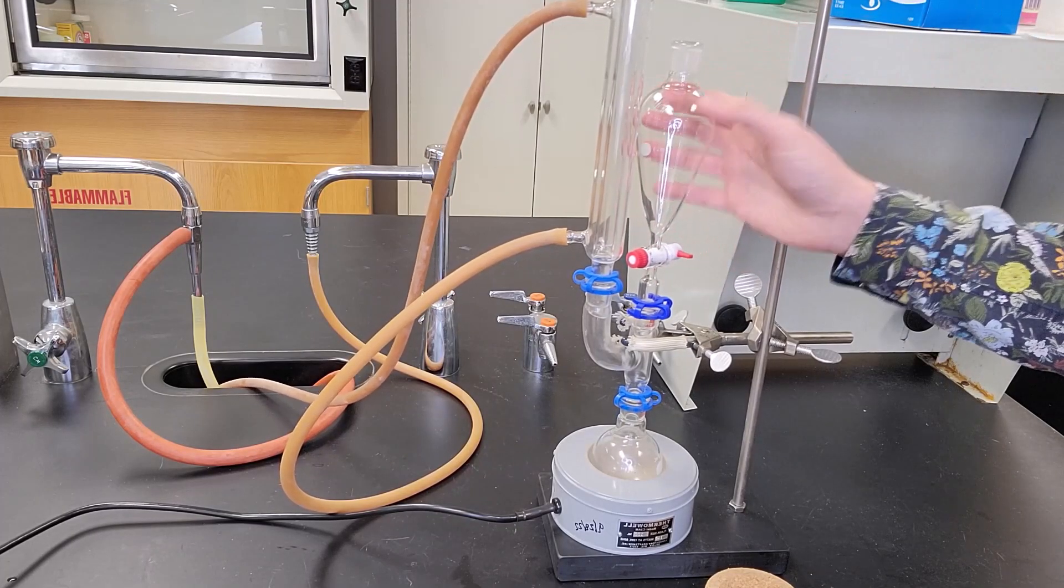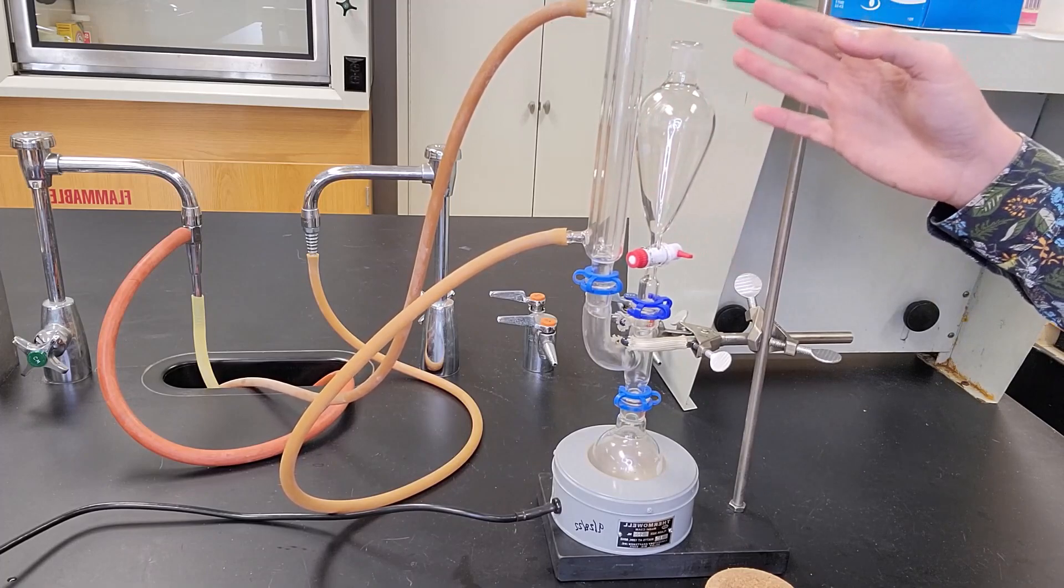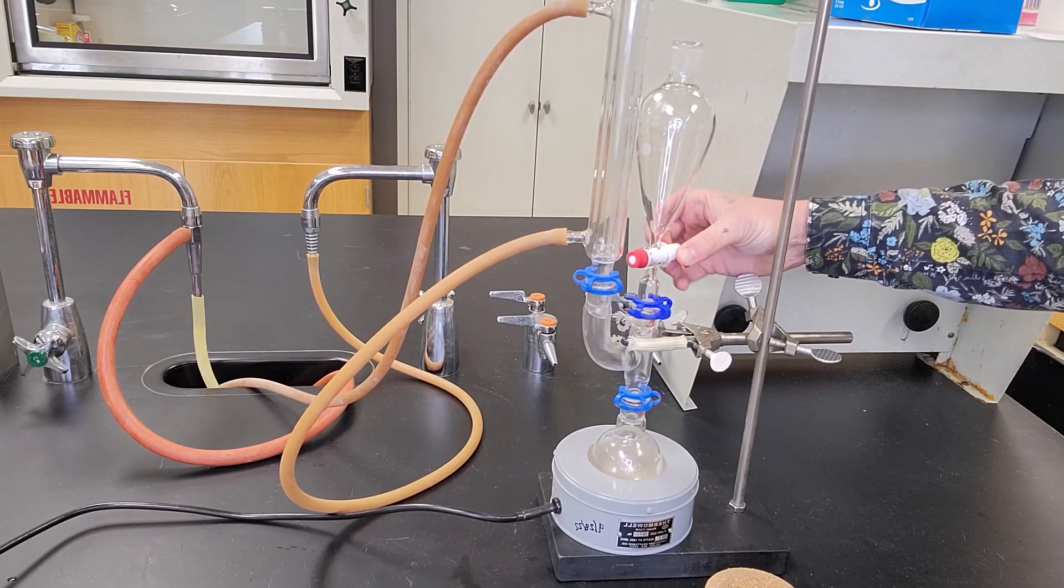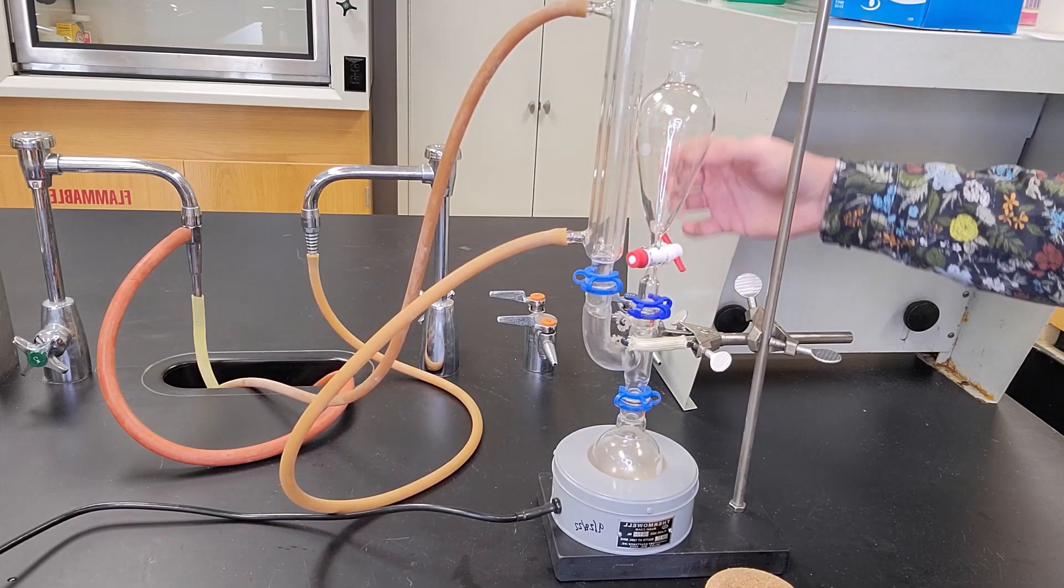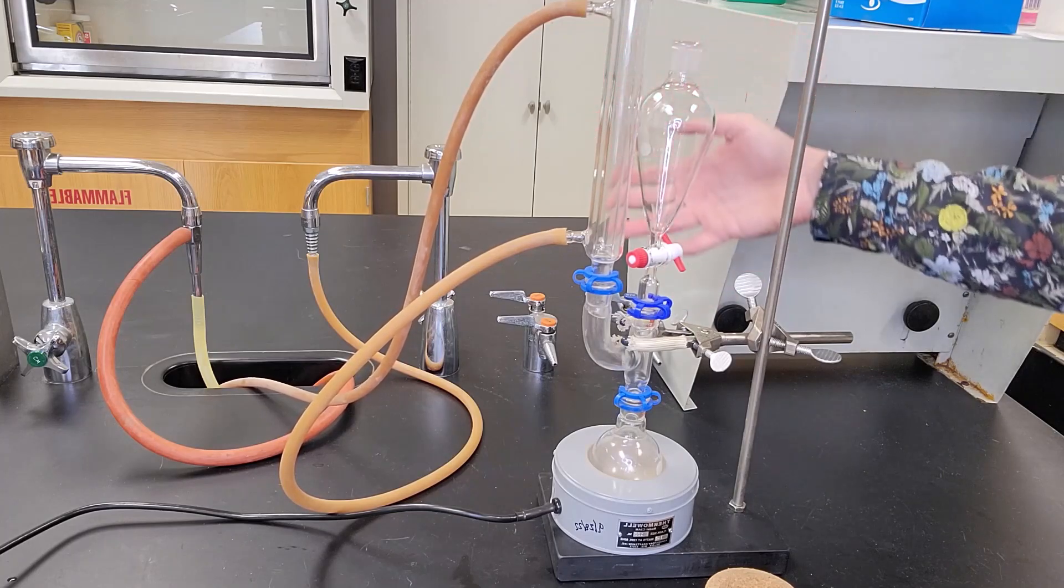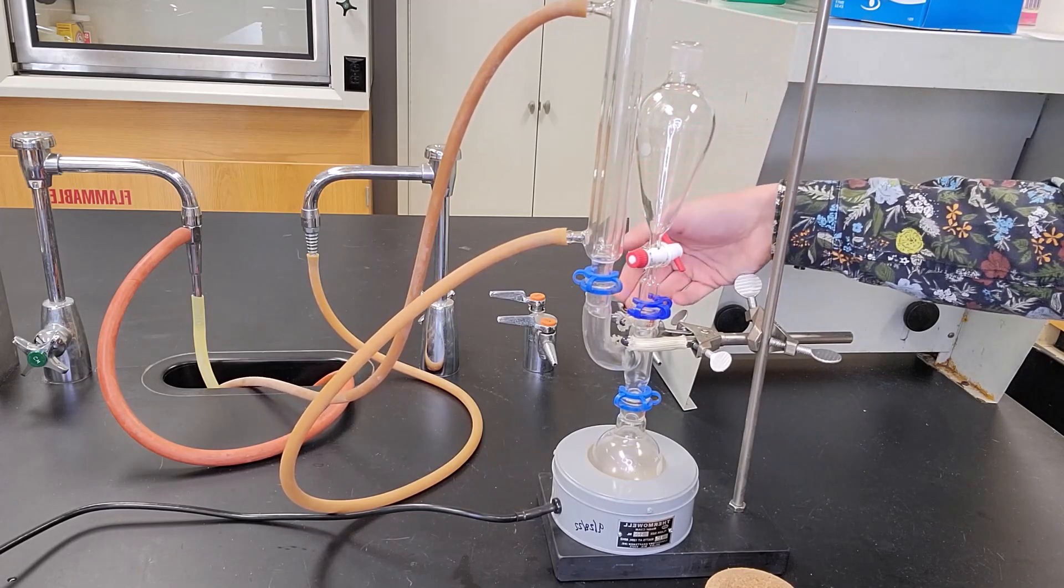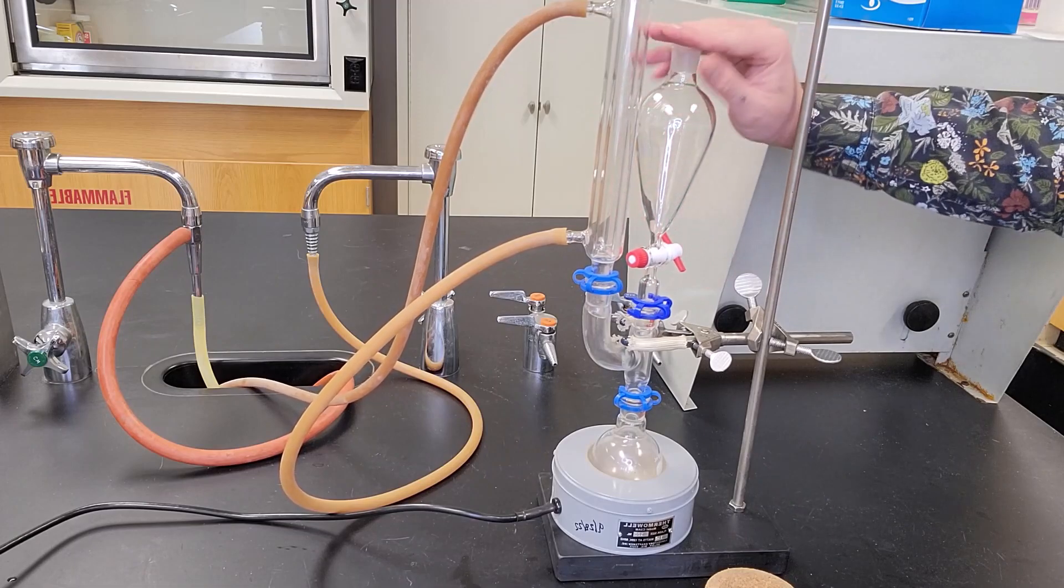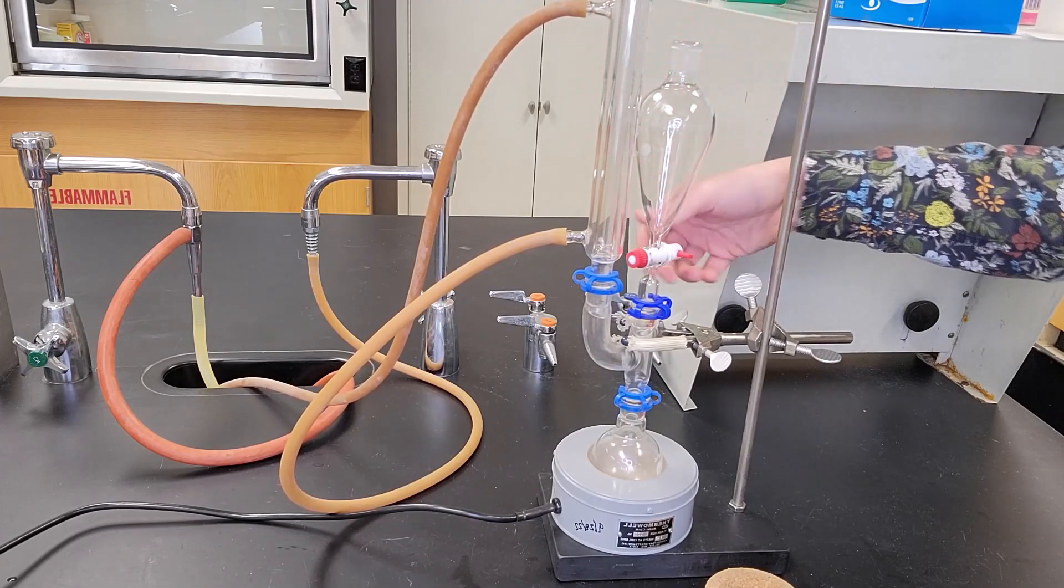Now, if this is a volatile liquid, I would probably cap it in between additions. But if I'm adding at a constant rate, I would need to leave this open. Otherwise, it would create a vacuum and stop adding. So I would cap this if I'm worried about evaporating. Otherwise, I would leave it open.